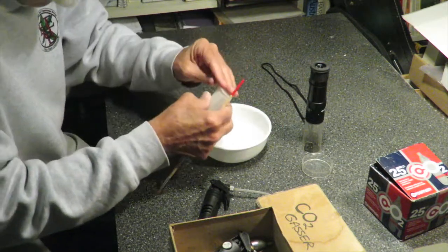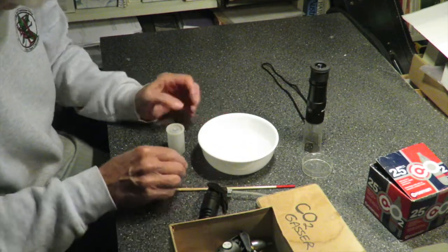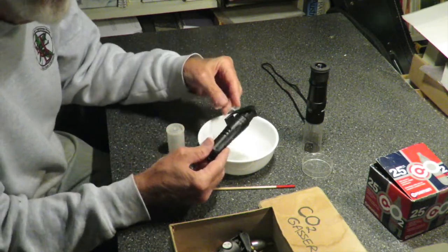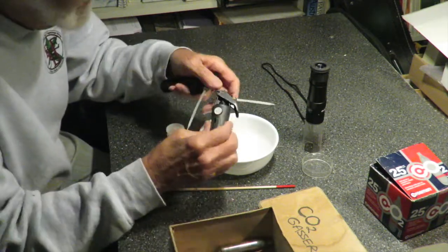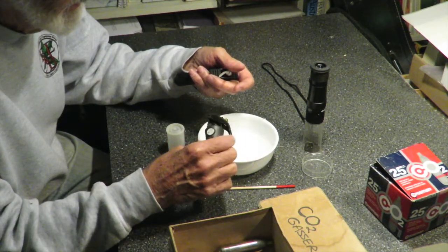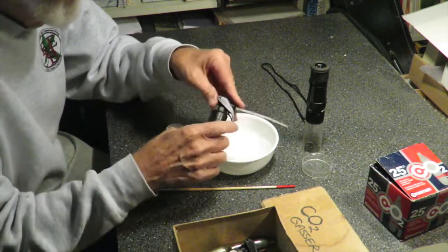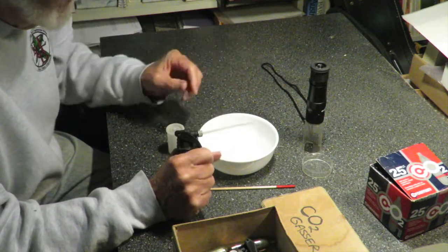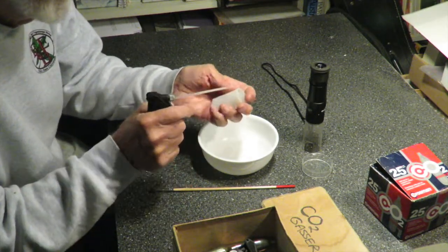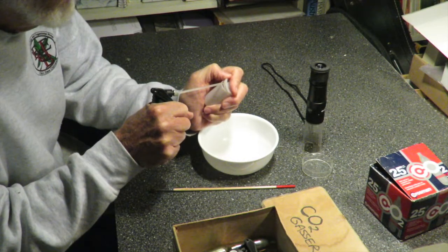Here's a great way you can actually get a better look at her — by using a little device that dispenses carbon dioxide. This one's called a Curtis Blaster; here's another one called an Air DC. Basically, they are keyboard cleaners that use compressed gas — in this case compressed CO2 — as a source of a jet of air. The CO2 is actually going to be useful because I'm going to use it to anesthetize the spider. I'm going to squirt some of this CO2 in here with our active little Cheiracanthium.